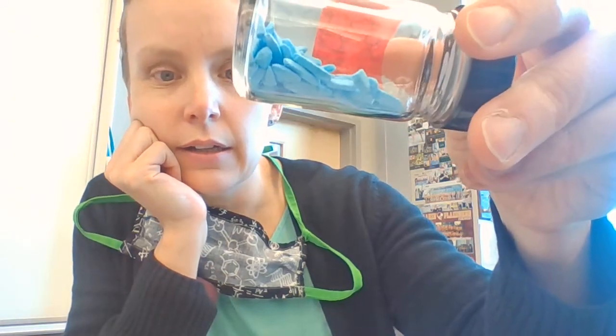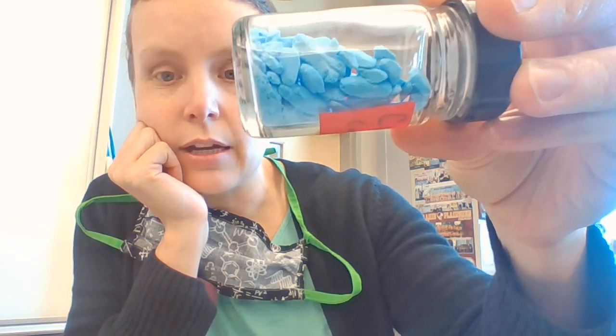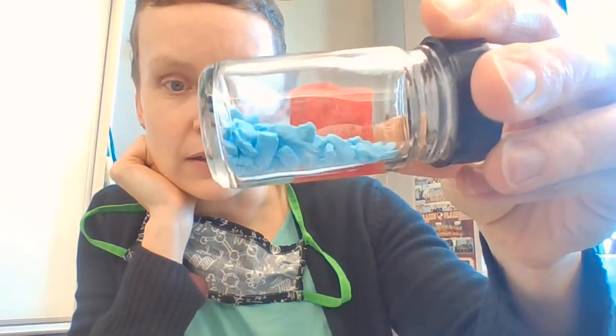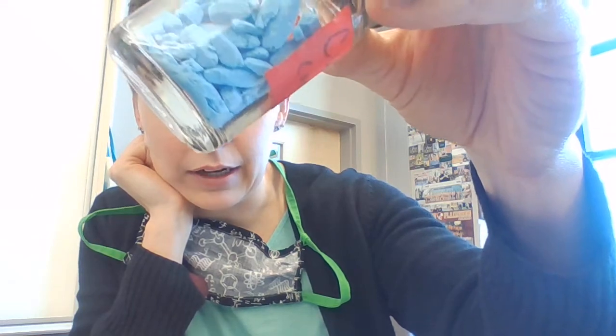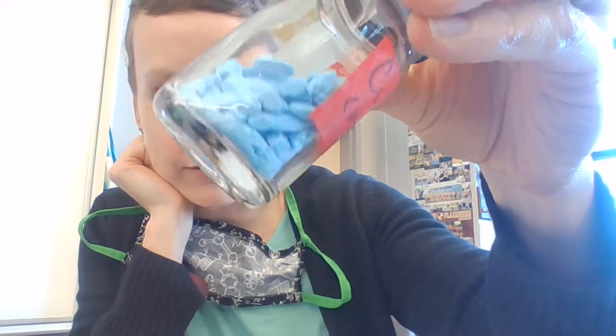And when we get that, here's what we get. Okay, so we have a kind of chalky blue solid. It is crystalline, but if you look at the bottom, there's definitely some powder in there, okay? But definitely big changes from the elements that it started from, okay?